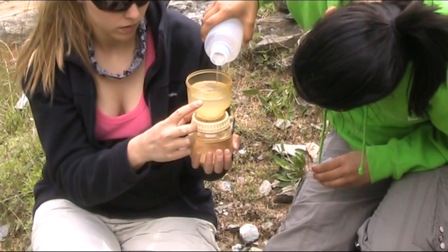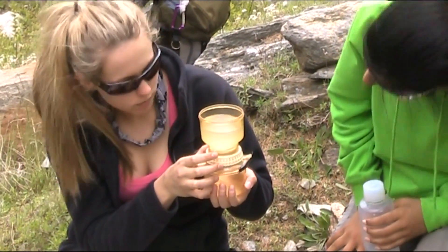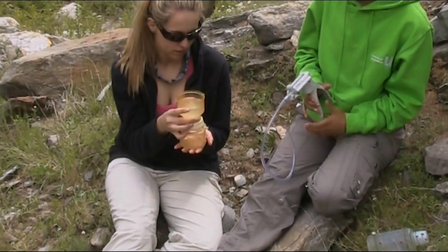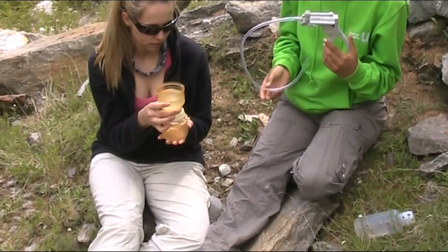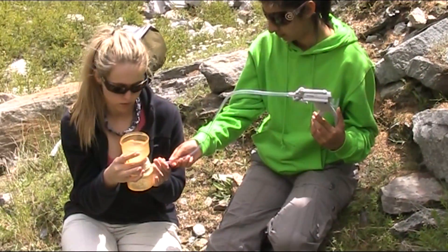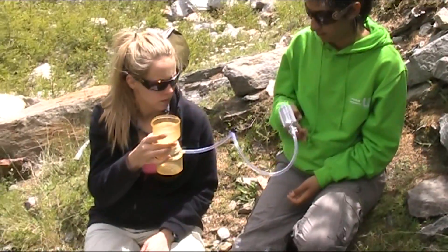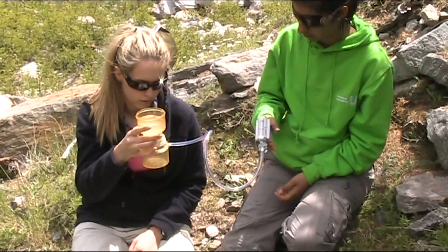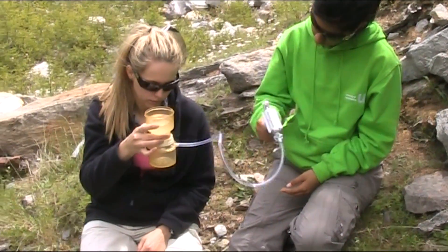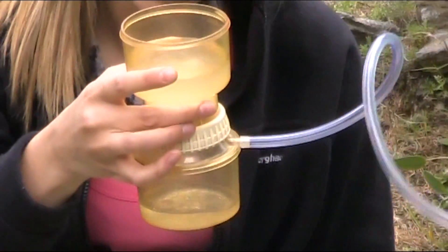Our final measure of suspended sediment load will be in grams or milligrams per litre. If you've got level ground, that's much better. If you haven't, a good idea is for both of you to look from each side of the housing, make sure the water is level and check that it corresponds with the 200ml mark. With the water sample in the upper part of the housing, attach the tube from a hand vacuum pump onto the lower part. We're drawing air from the lower part of the housing, which sucks the water through the filter membrane. We raise the vacuum pressure by pumping — give it 30 or 40 pumps to begin with. Water is now starting to trickle into the lower part of the housing, nice and clear, because the sediment is being retained on the filter paper.